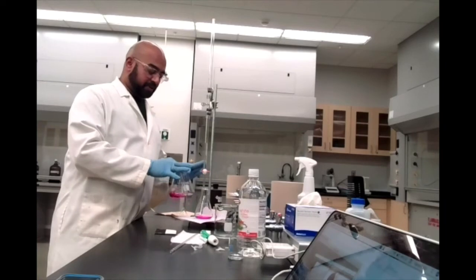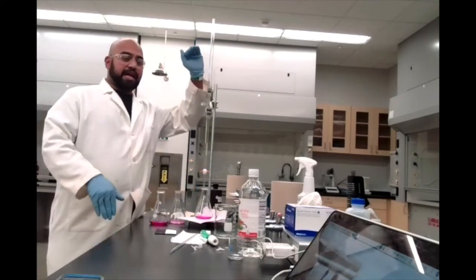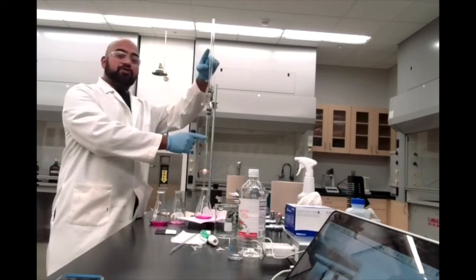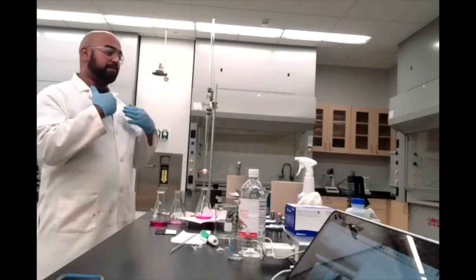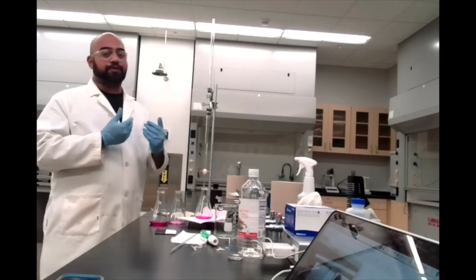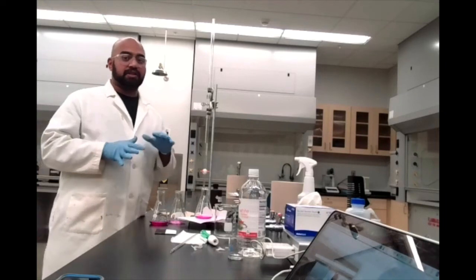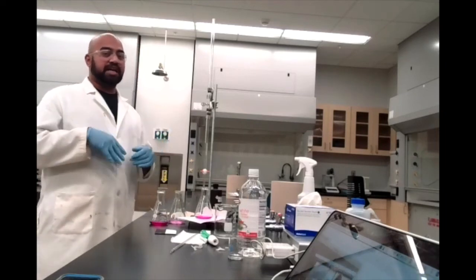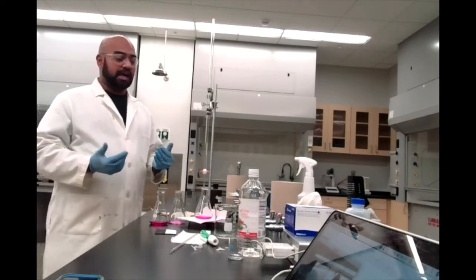If you take the initial reading from your burette and subtract it from your final reading, that tells you how much sodium hydroxide you added to your vinegar. Now, we did 3 trials, so you want to take the average of those 3 volume readings. That first trial, even though it was a little rough compared to the other 2, we didn't know where the endpoint was. You'll probably find that it actually was relatively accurate.